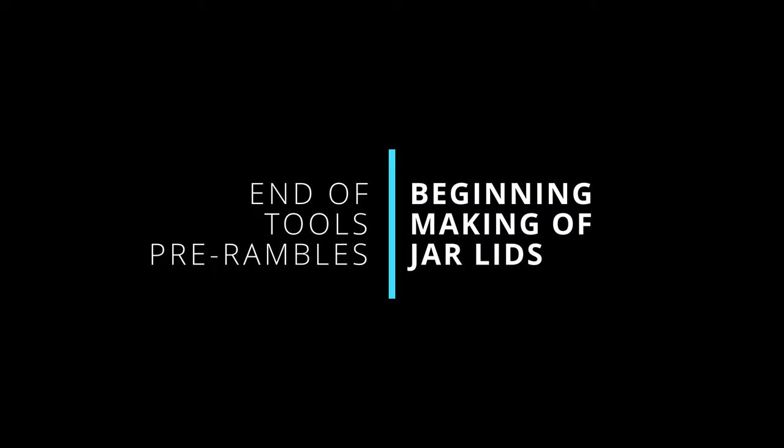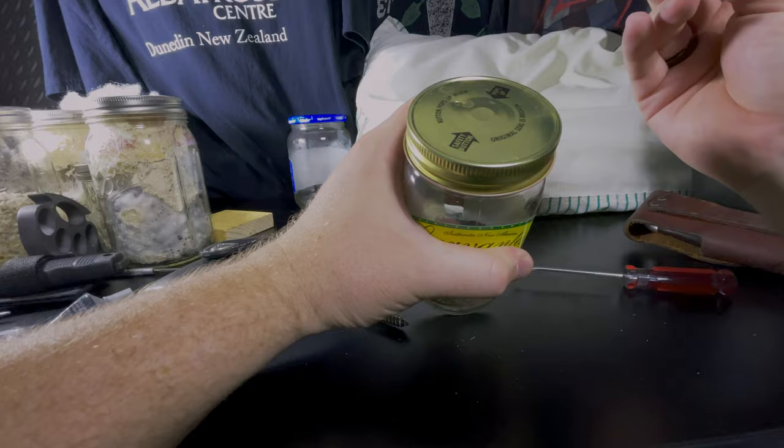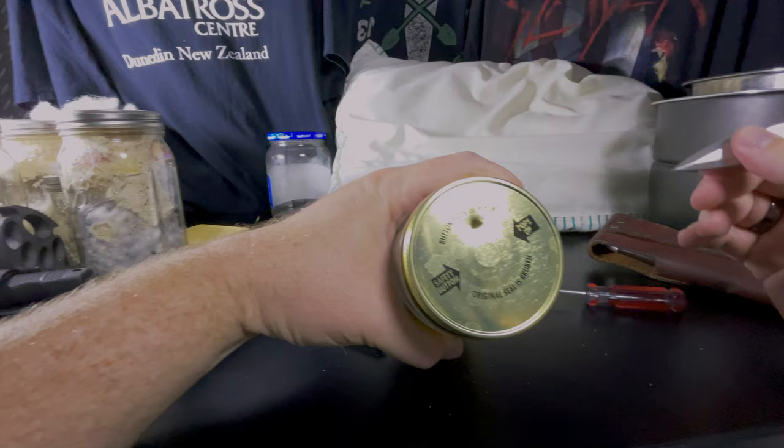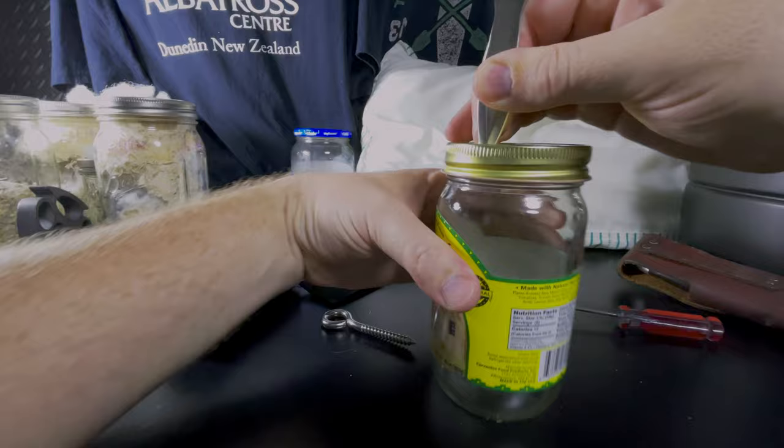But I'm gonna bet these lids are so thin, you can just push, yep, and twist, and there's a hole. That's good enough for a needle or a vent. It doesn't have to be measured precisely like everyone will try and show you in other videos online. And we just need two holes. So push gently, let it sink, twist, there. Injection port vent or vice versa.